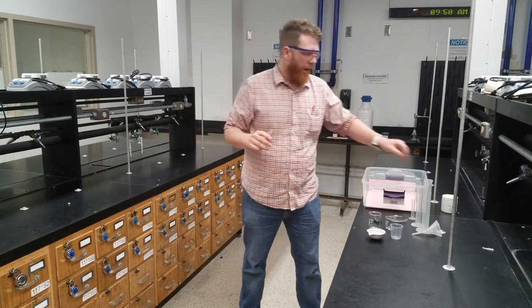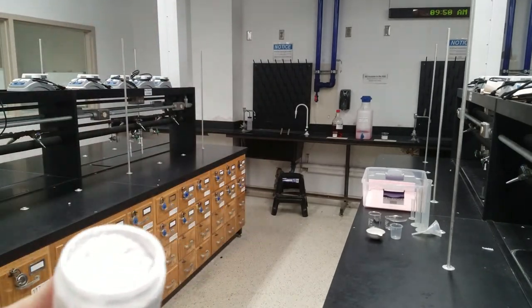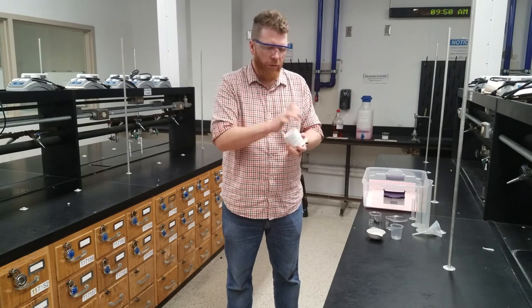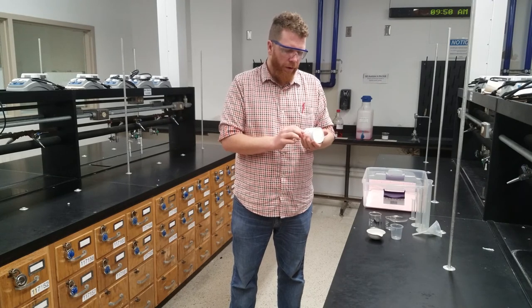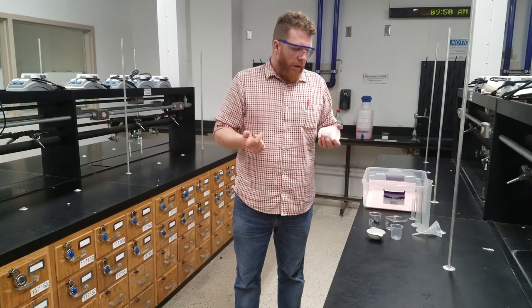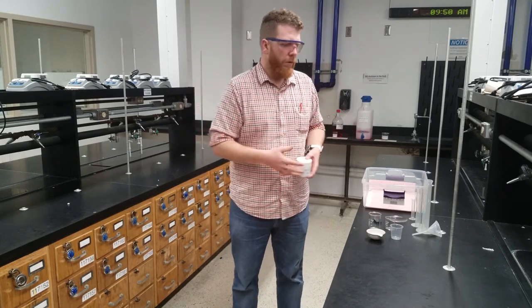What you are doing in this lab is a separation — separating based on chemical and physical properties. You're looking at a mixture that on initial inspection might look like baking soda, but there are totally three different things in here: first, calcium carbonate, which is chalk; second, metal beads or iron beads; and finally silicon dioxide, which is sand. You're going to have to separate these three things using all this different glassware.